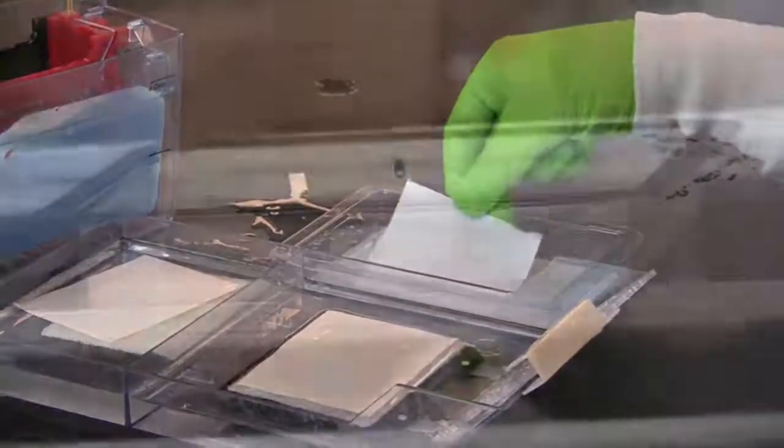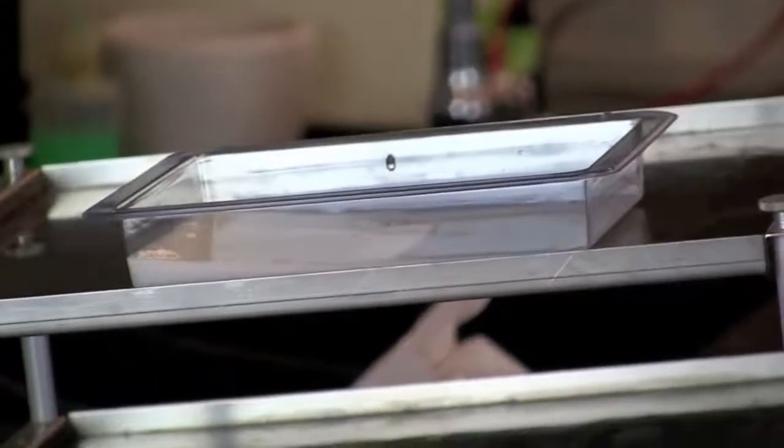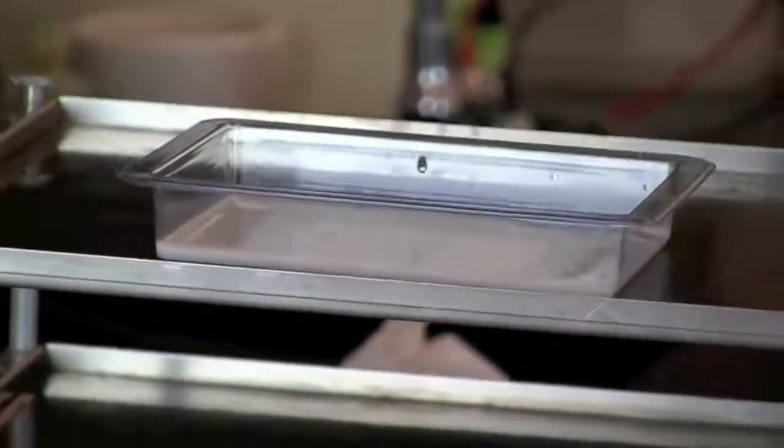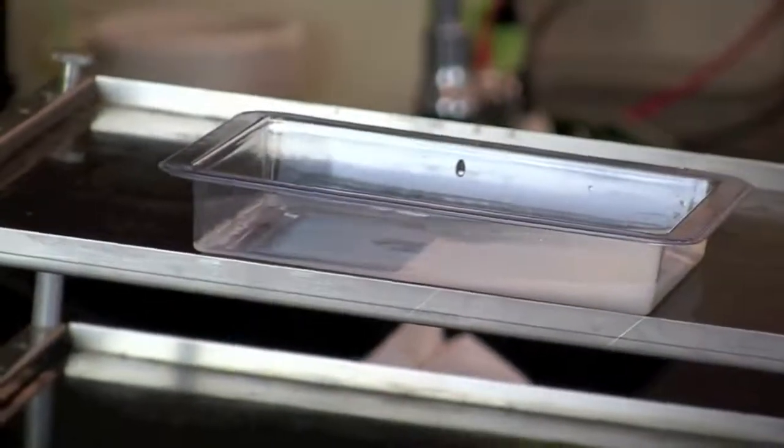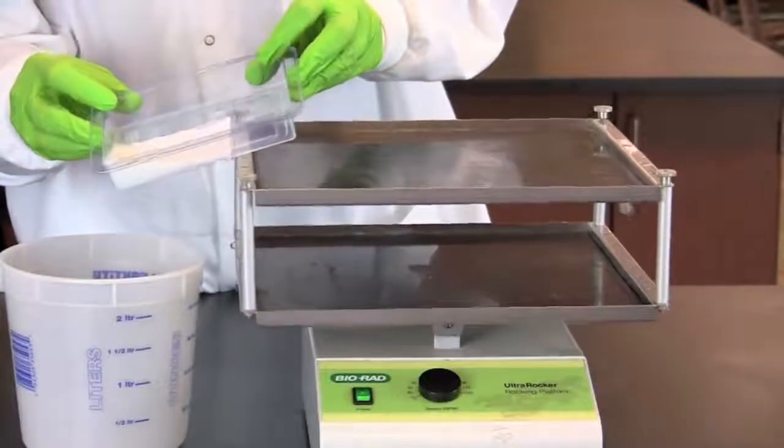Immerse the membrane in 25 milliliters of blocking solution and incubate it for 15 minutes at room temperature on a rocking platform. Pour off the blocking solution.